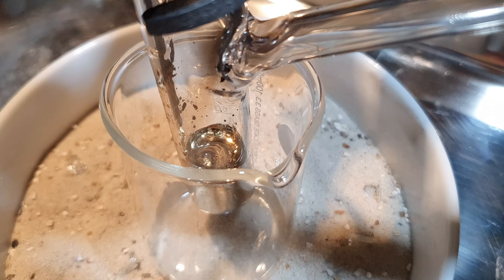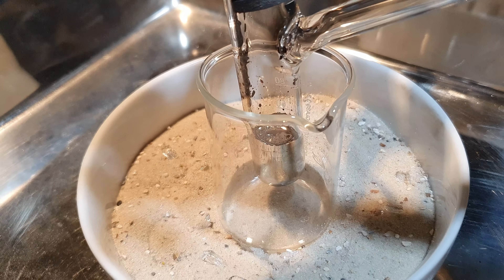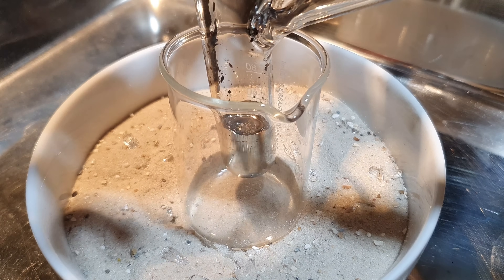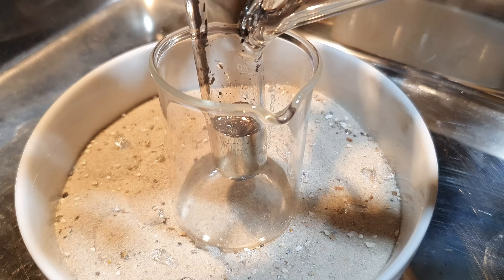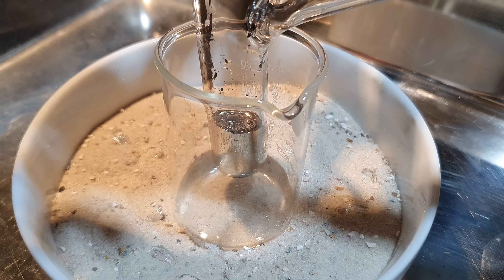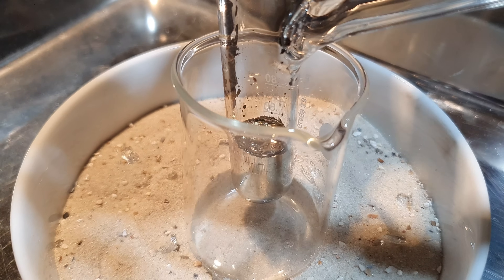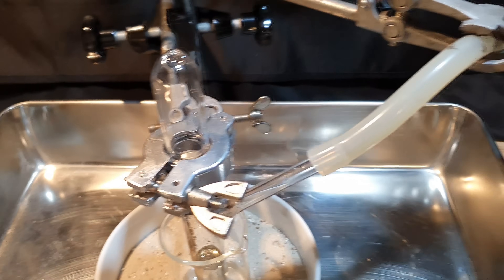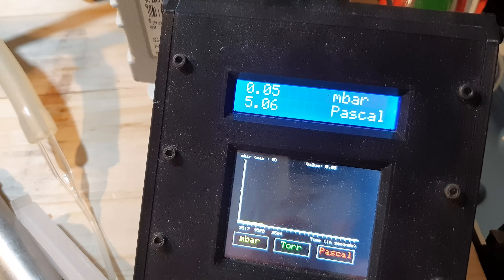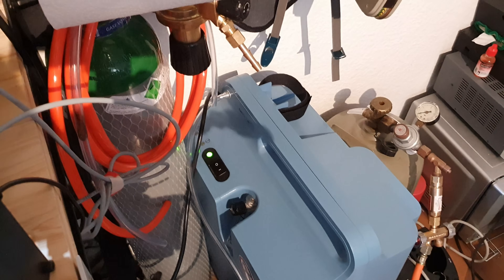With a gentle stream of argon flowing through the inlet of the reaction vessel, I disconnected it from the still and closed it with a KF flange. The cesium in our reaction vessel looks good. We have a little bit of oxidation up here, but that's not really a problem since we are going to introduce oxygen to the system anyways. So now I'm going to pull a vacuum on the reaction vessel and then slowly introduce some oxygen, produced with my oxygen concentrator.